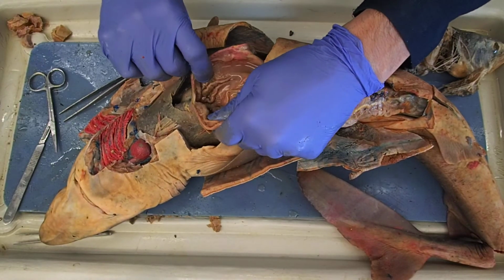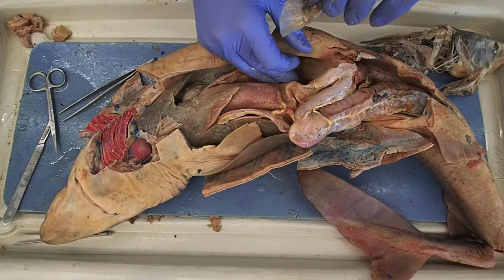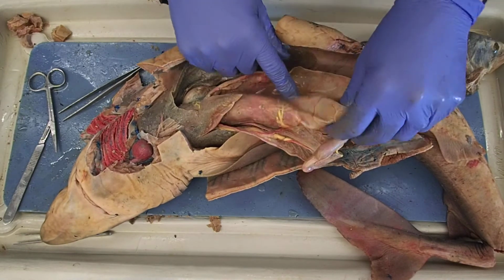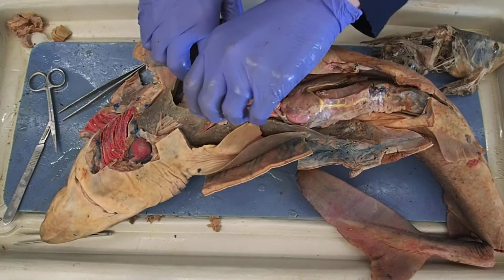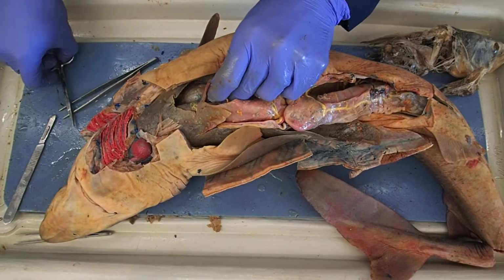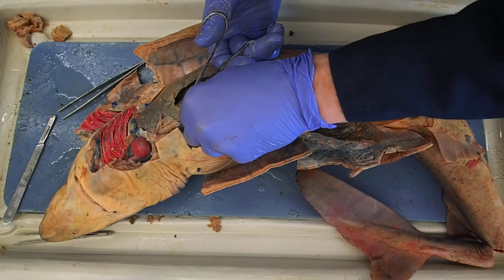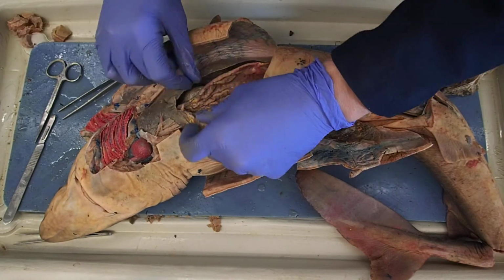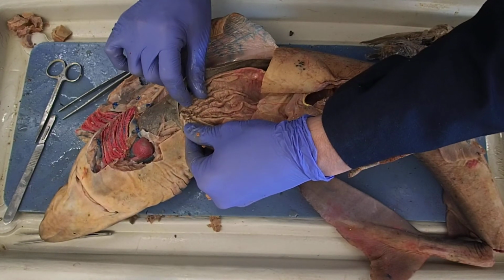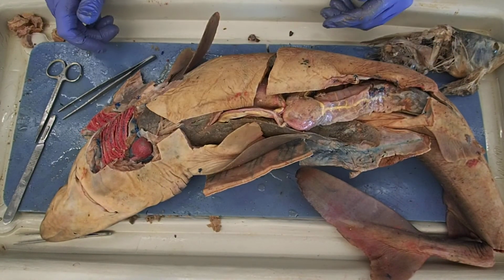And then we start making our way up. Looks like that was it. He came across a big old fish and ate it. Operculum. That was the scale covering the operculum. Remember, we can keep cutting up along the sides. I see my rugae. Up in here I can start to see some papilla, esophageal papilla. Cool. All right, I think that does it. Good luck.